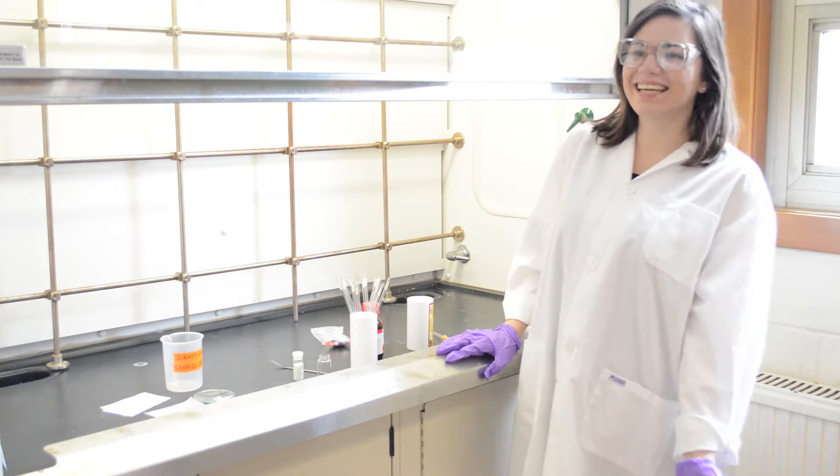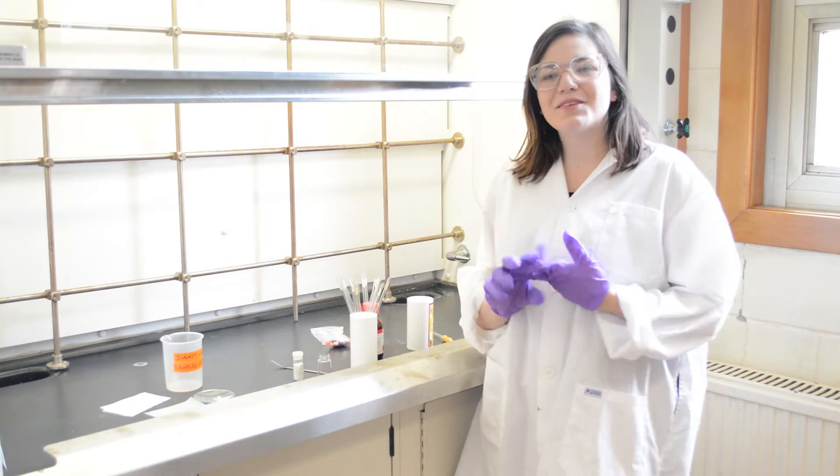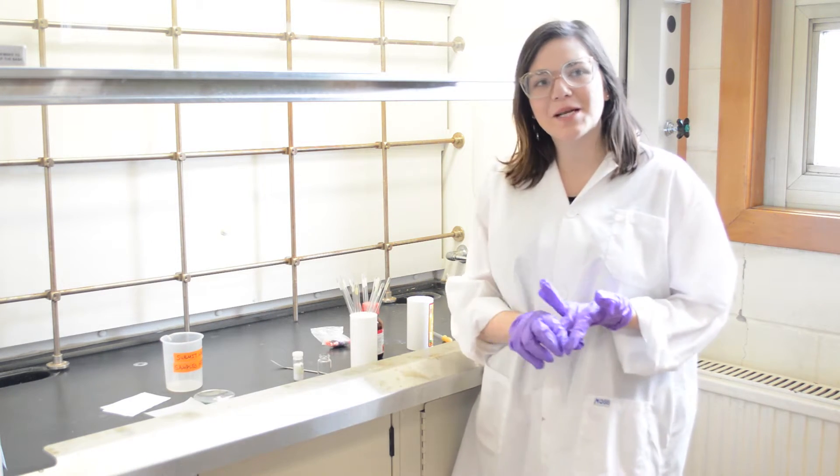NMR sample preparation. The two types of NMR that we most commonly do are proton NMR and carbon NMR.